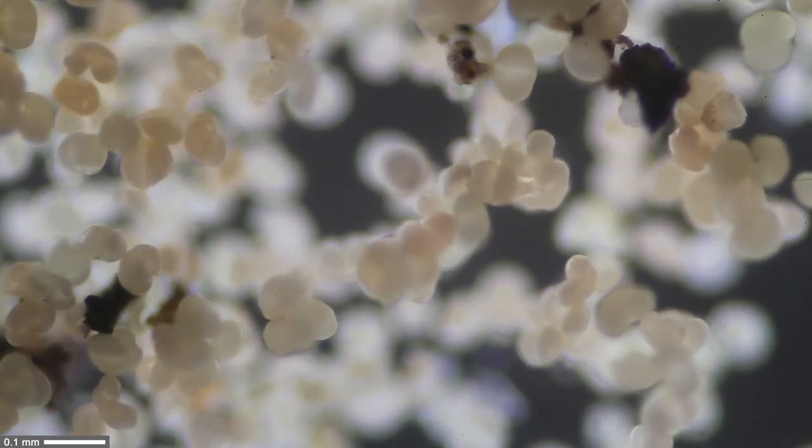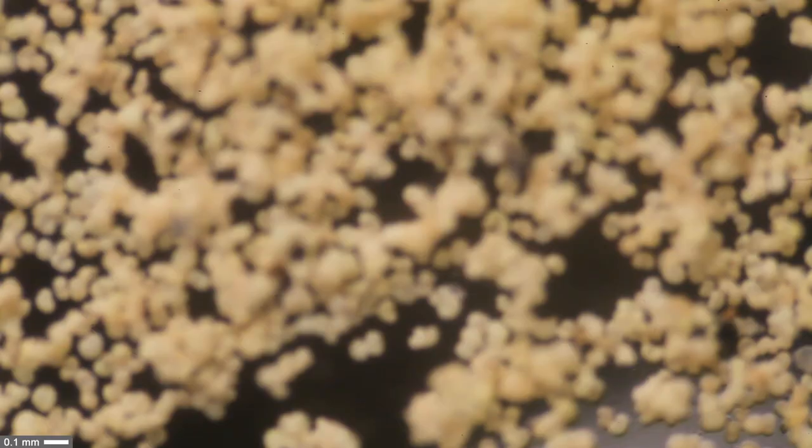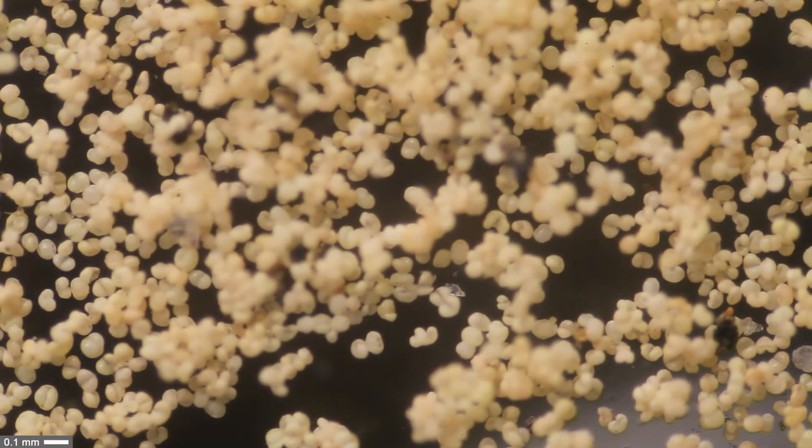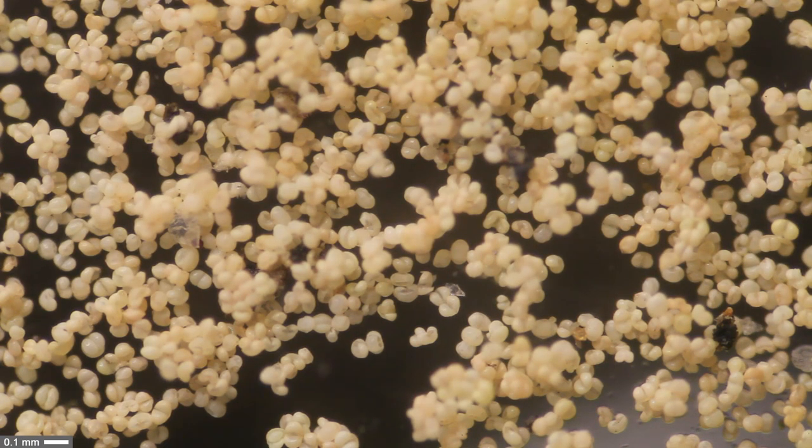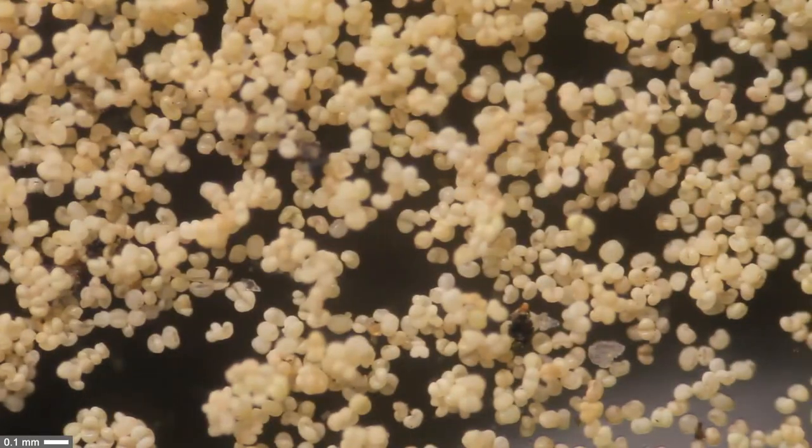Of course, I not only used dark field but also used epi illumination, which means I switched off the microscope light and then used my desk lamp to shine some light from the top. Now you can actually see even better that the pollen grains are stacked on top of each other.